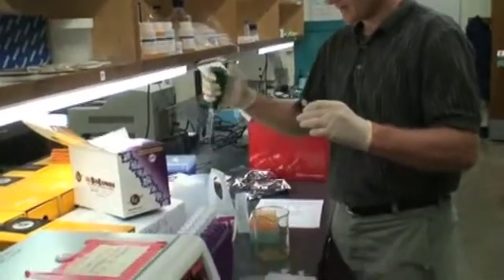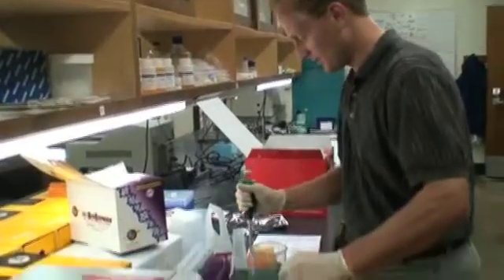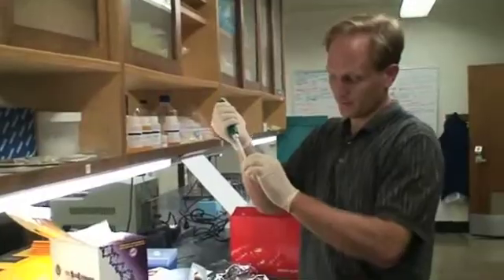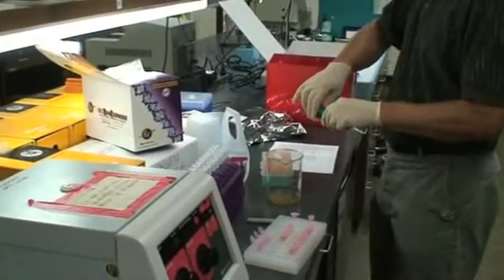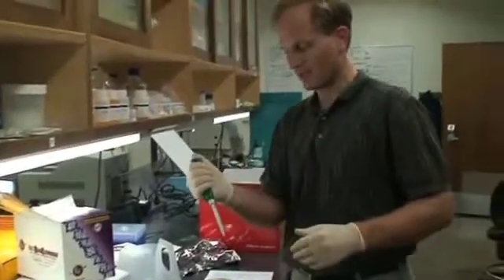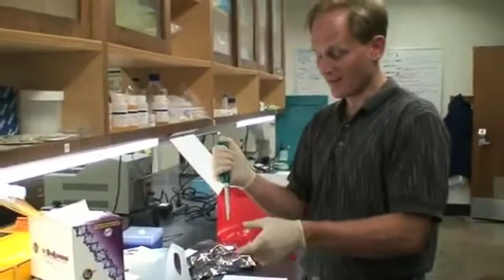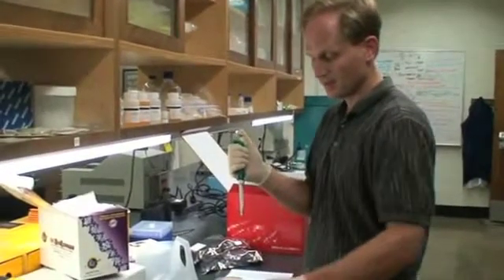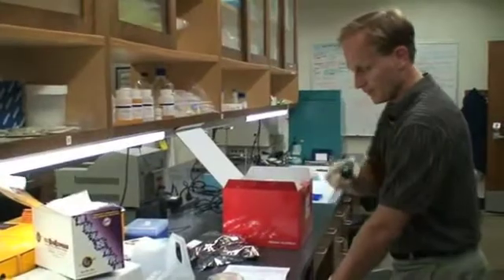Don't put liquids in the trash as much as you can avoid it — particularly the media — because it'll end up stinking after a while. So for demonstration purposes, I'm just going to raise this all the way up to 200 microliters. You'll notice as I was pipetting, I wasn't lifting my thumb up all the way and filling it full to 200 — I just needed to have excess room to pull up any amount up to 200 microliters of media from those tubes.